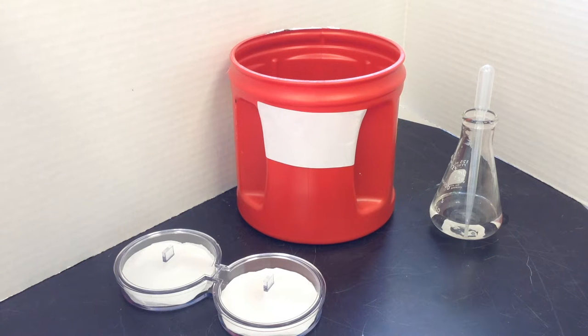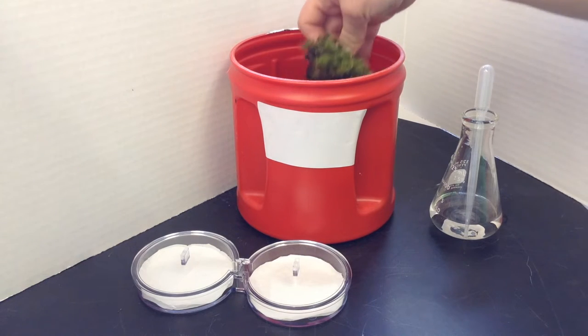This is a video for Science 7 and ecosystems, and we're going to use choice chambers and give some sow bugs a choice. And here's what we're going to test.